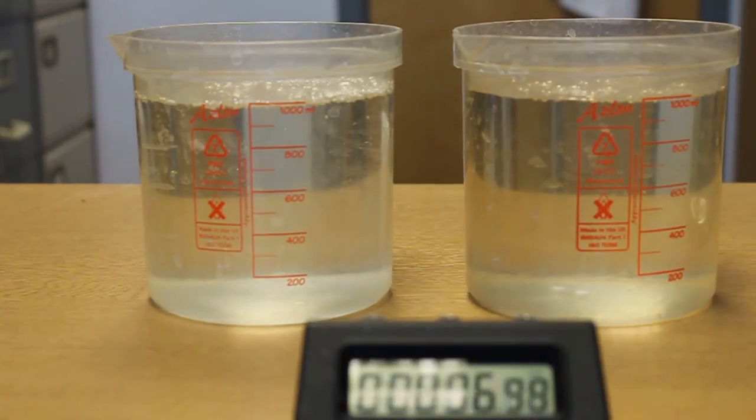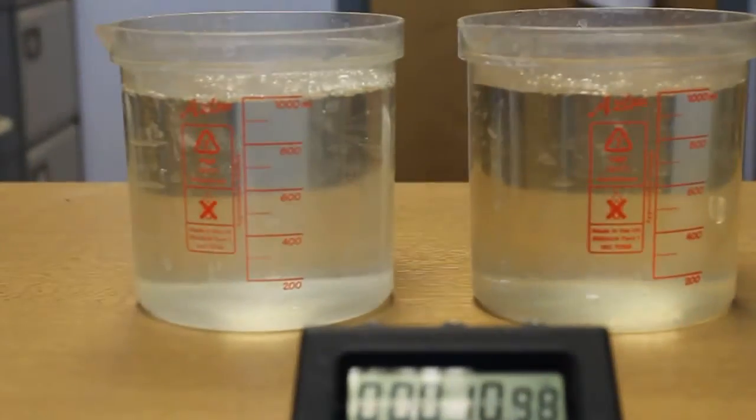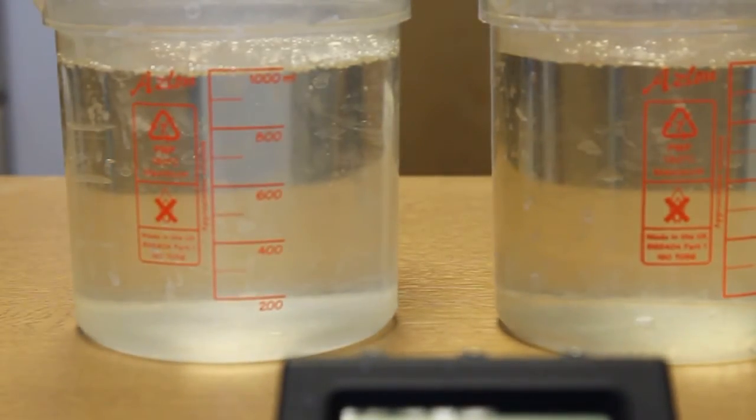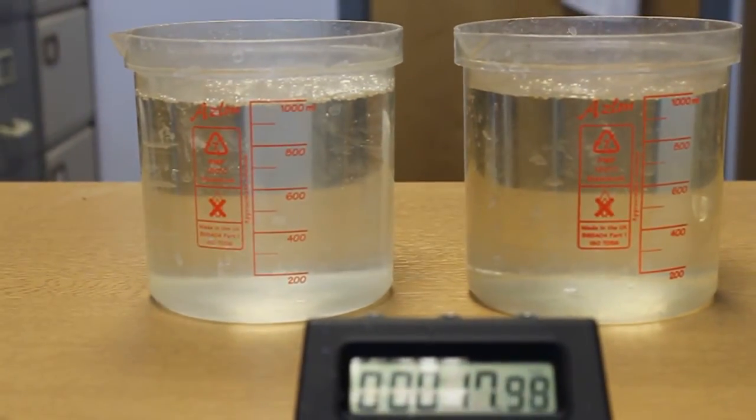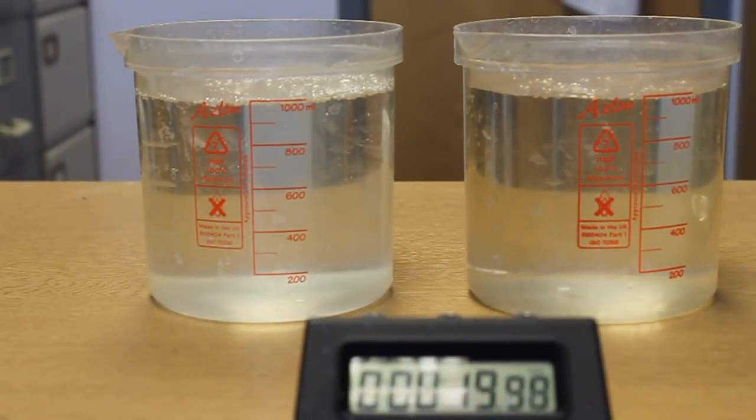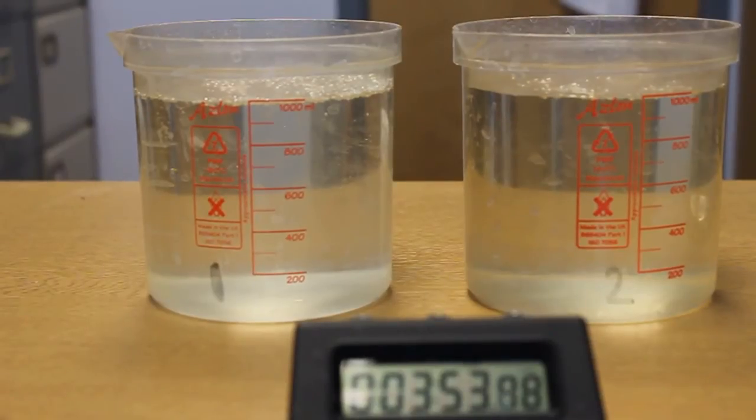If you look in the picture you can see that the tablets are starting to effervesce and they will gradually dissolve and the chlorine will react with whatever there is in the water.